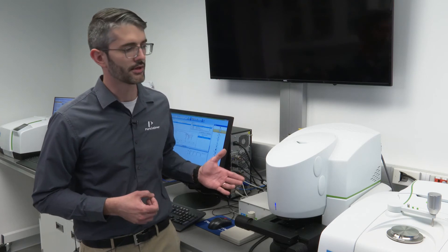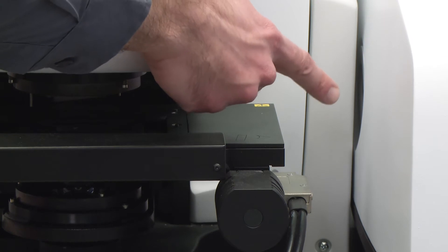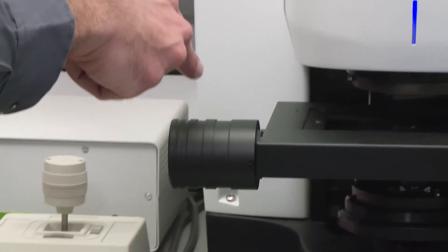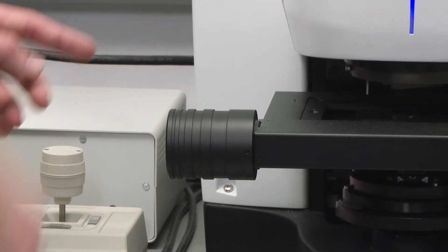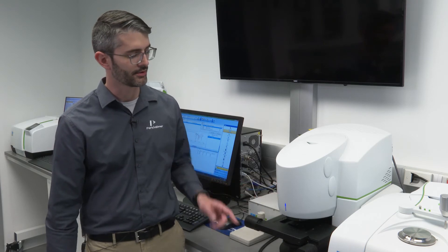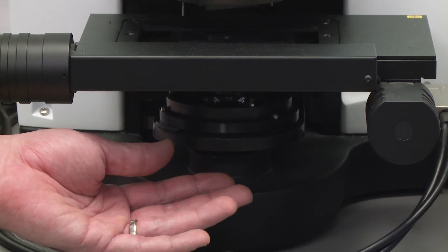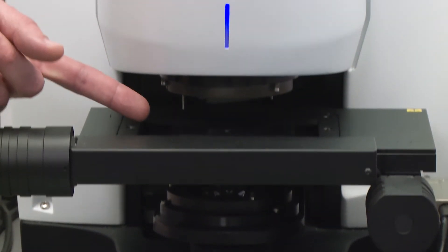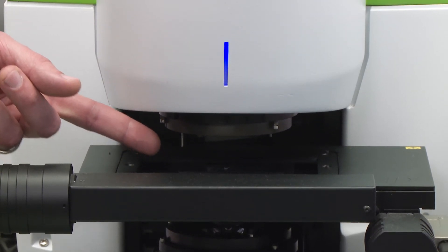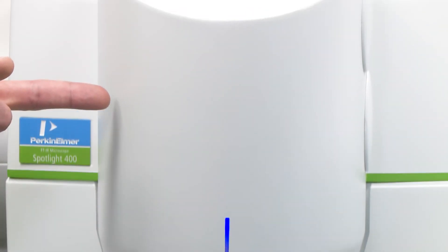Here we have the Spotlight 400 system. This infrared microscope takes the infrared beam from the FTIR on the right-hand side. The infrared beam comes in and is reflected by a series of optics within the base of the microscope. Those optics allow the infrared beam to go to the lower objective, where it is then focused on the sample, which is placed in the sample stage in the microscope. Once the infrared light has interacted with the sample, the light goes to the upper objective and is then passed to the infrared detector.